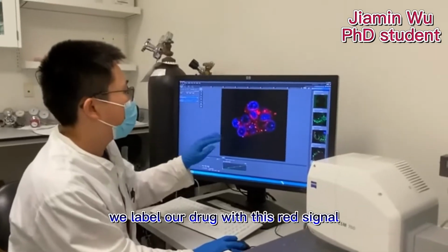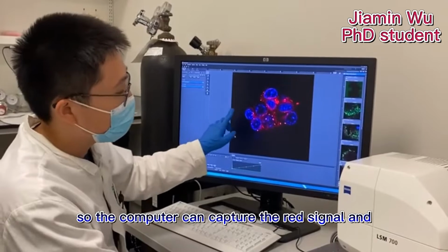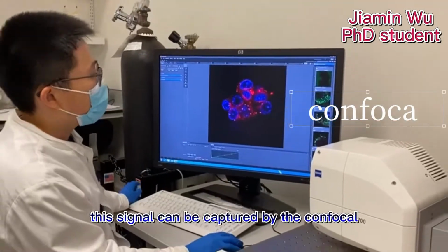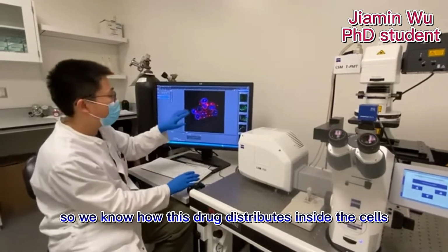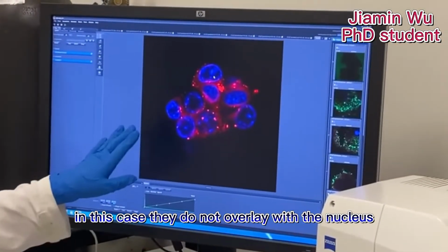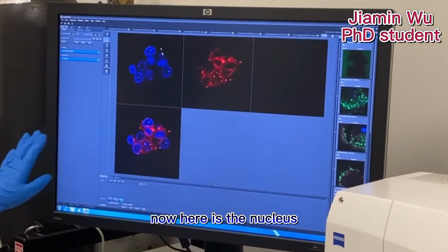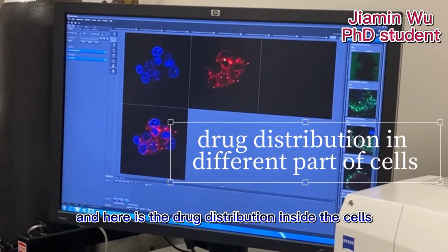We label our drug with this red signal, so the computer can capture the red signal, and the blue signal is the nucleus. So when we put our sample in the confocal, this signal can be captured by the confocal, so we know how this drug distributes inside the cell. In this case, they do not overlay with the nucleus. And we can also separate the different channels so we can see it more clearly. Now here is the nucleus, and here is the drug distribution inside cells.